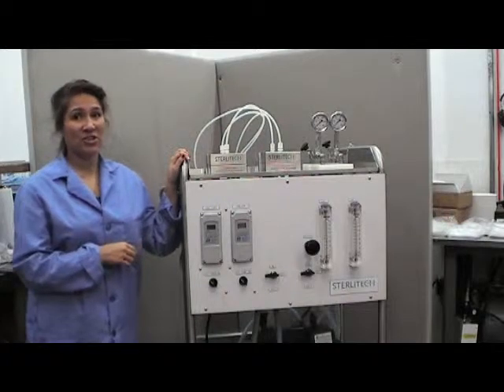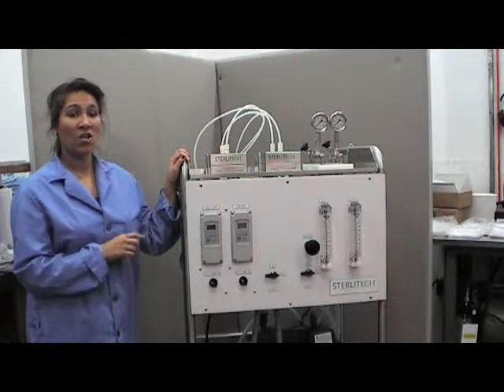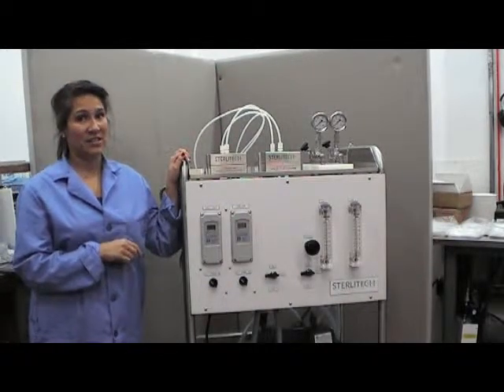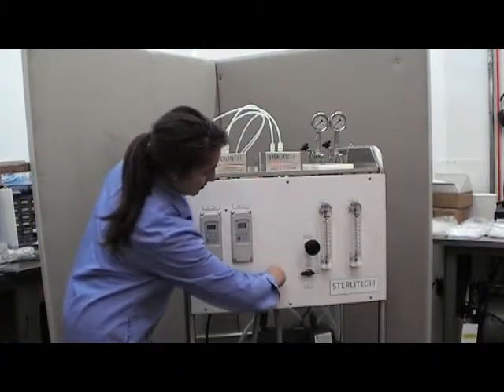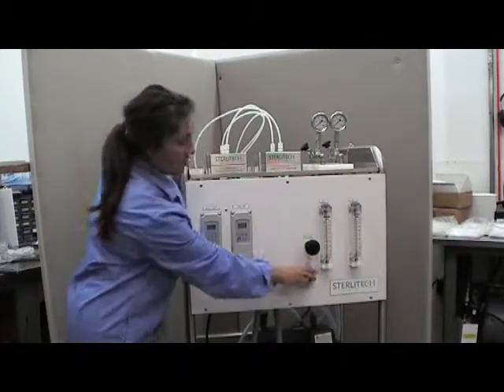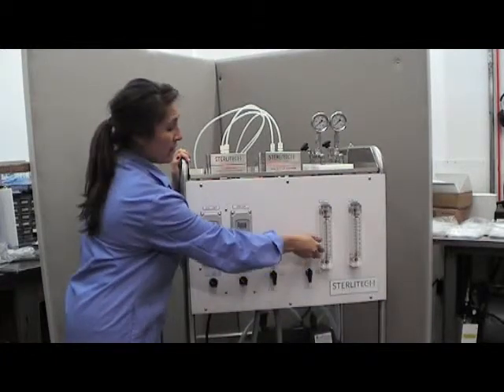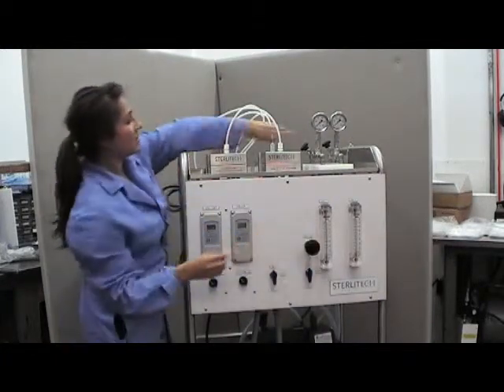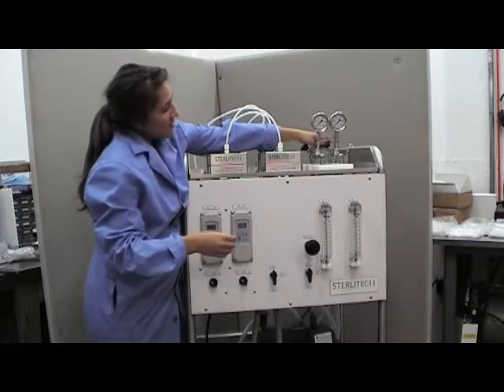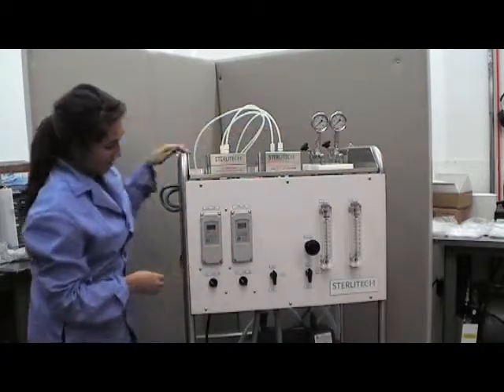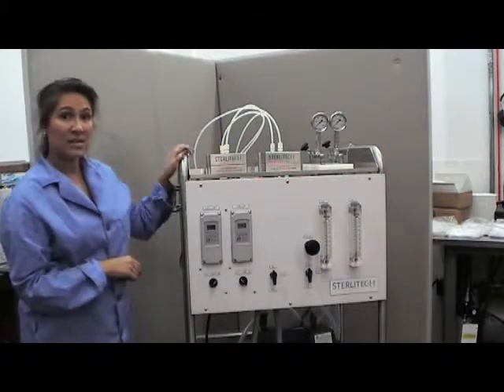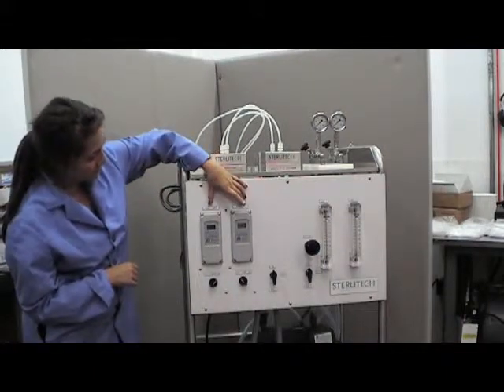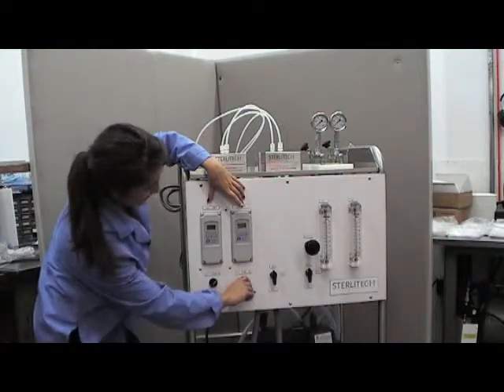Before starting operation of your system you'll want to make sure that all of the valves and the lines are fully open. So to start we'll turn both lines on, make sure our valves are completely open by turning the knobs to the left, then you can turn on the system. You'll want to make sure that you can see both of the readings appear on the chillers before turning the pump on.